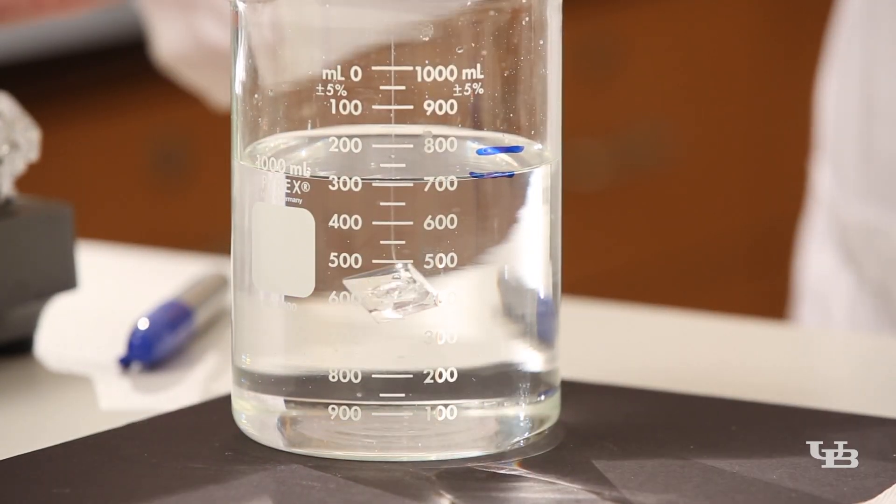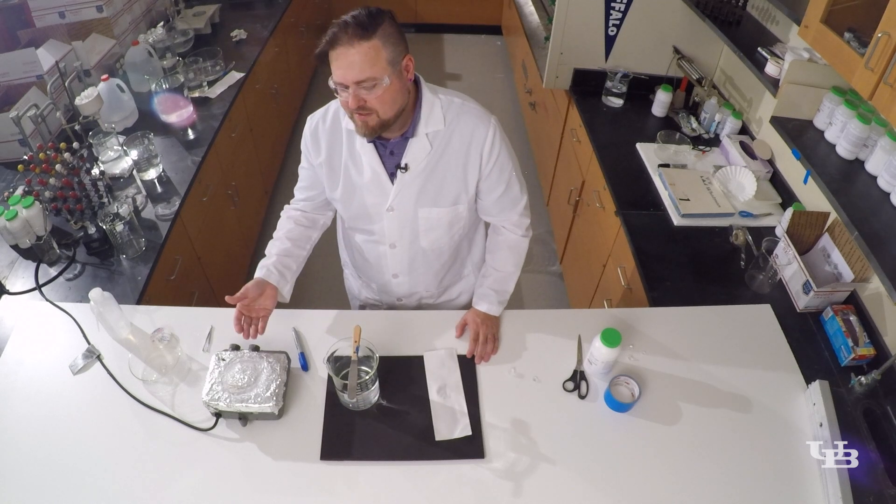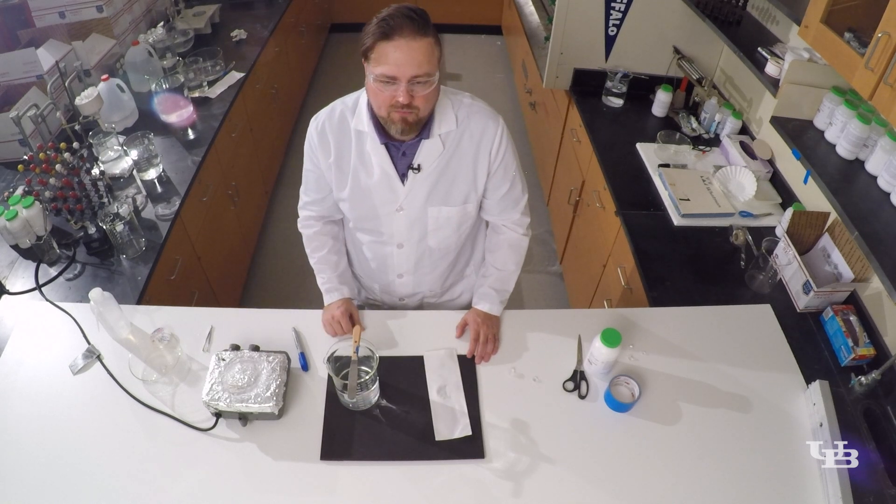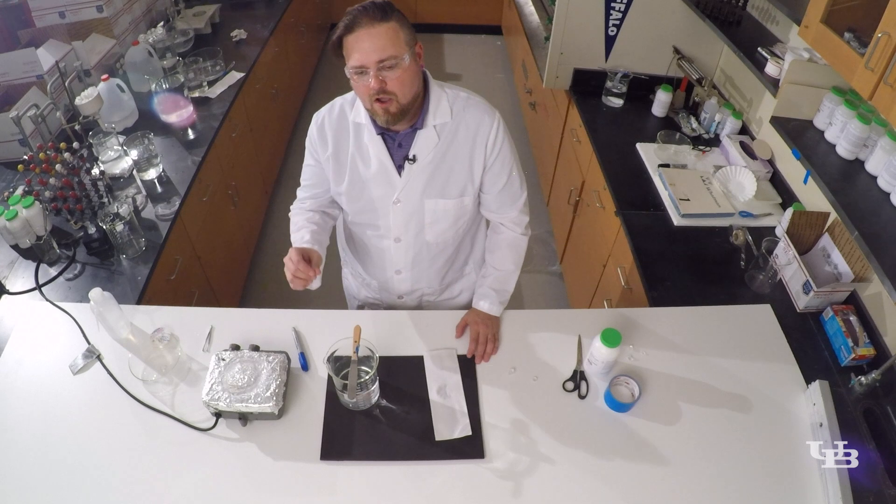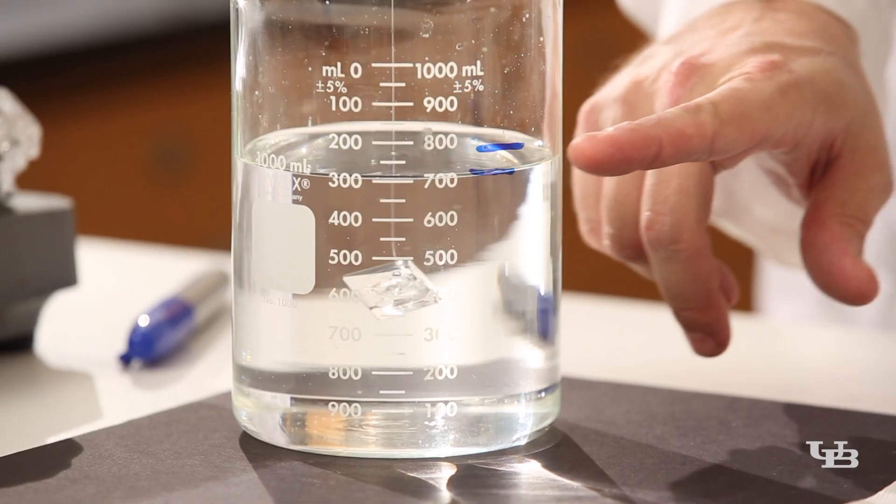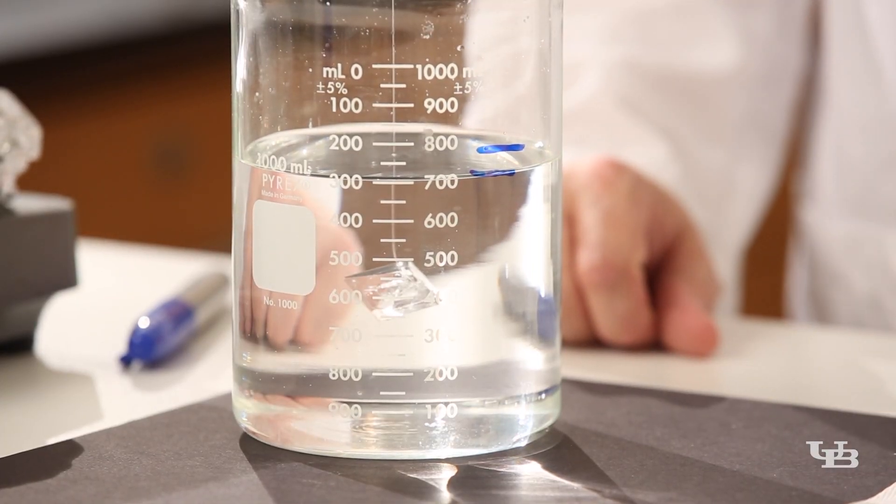We're going to have to remove the crystal, reheat the solution, add back in a bit more water and we'll know how much water to add because of our second little blue line.